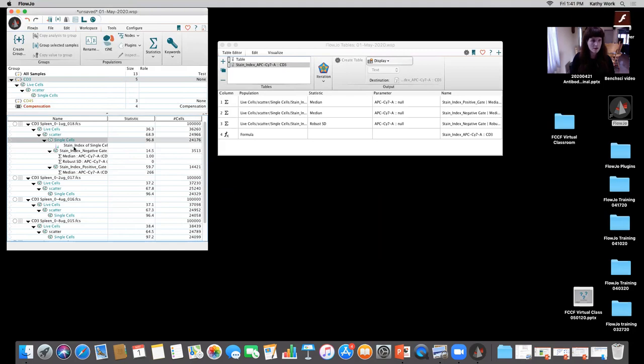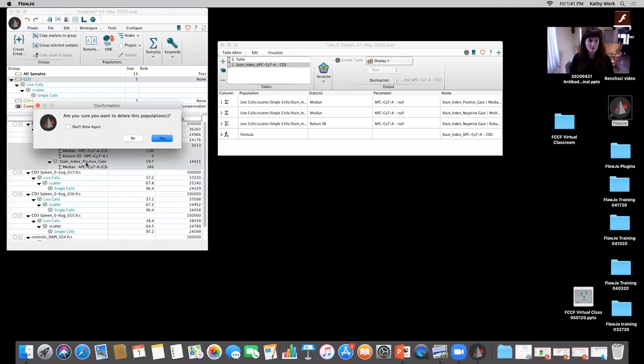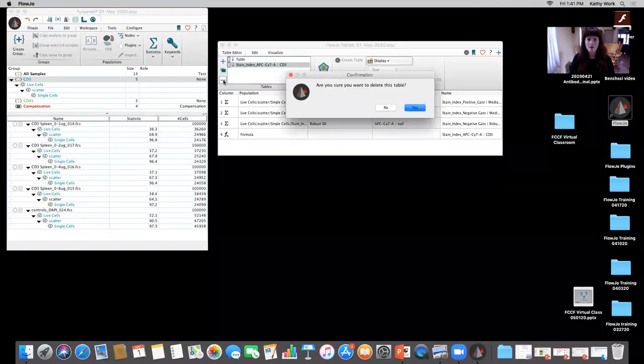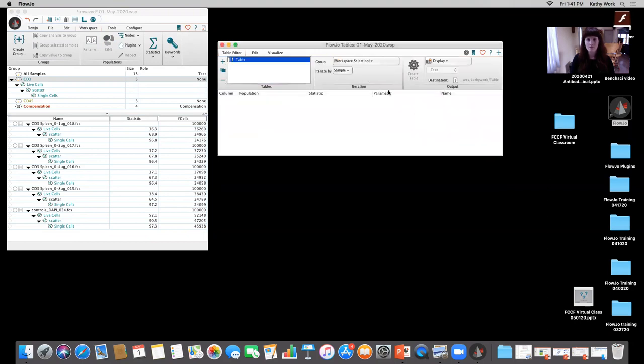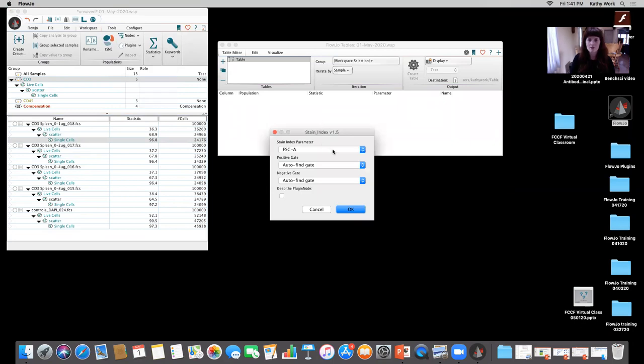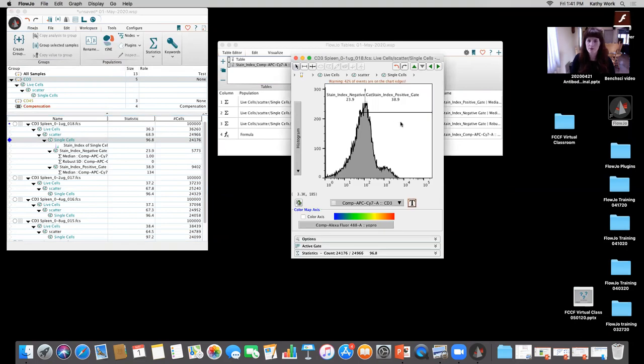So I'm going to close out of that. I apologize. I'm going to delete the stain index and all of these parameters by just hitting shift. And I'm going to delete this table right there, that little minus button. So I'm going to go back in, I'm going to do a plugin, so I'm going to go to stain index. And now if I go down, you have uncomped and you have comped. So we always want to make sure when you're multicolor and you have comp data that you choose the correct one. Hit OK. Go back over, wasn't too painful, right?